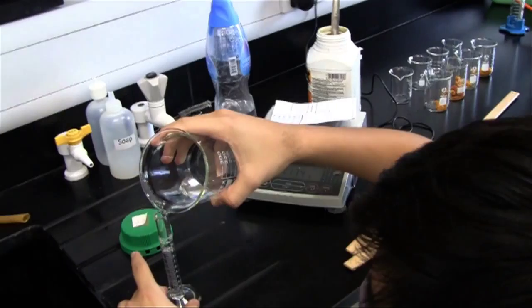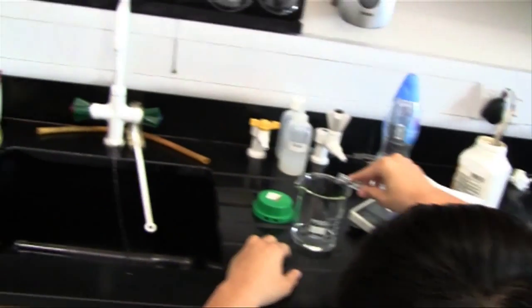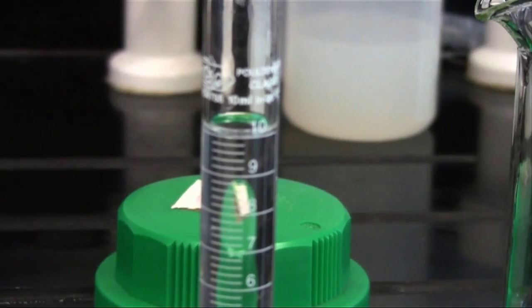Each will be dissolved in 10 milliliters of hydrochloric acid. We want to test whether the different concentrations of iron 2 chloride and iron 3 chloride will create an effect on the overall magnetic strength of the ferrofluid.